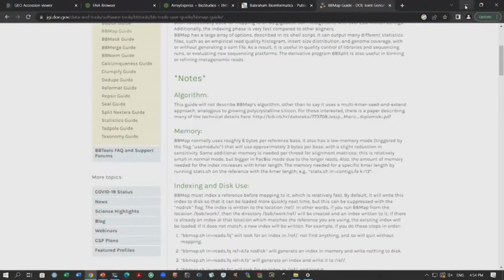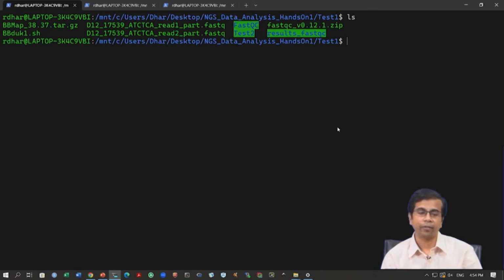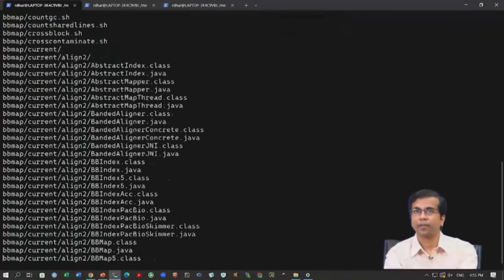What I have done is I have downloaded this already in my system. You can see this BBMap file here. We need to extract this and utilize it. To extract, this is a tar.gz file. You remember hopefully the compression that we have talked about, and that information will be very useful. This is a tar archive with gz compression. So, we need to use this command tar -xvf or -zxvf, and BBMap. This will decompress the whole thing.